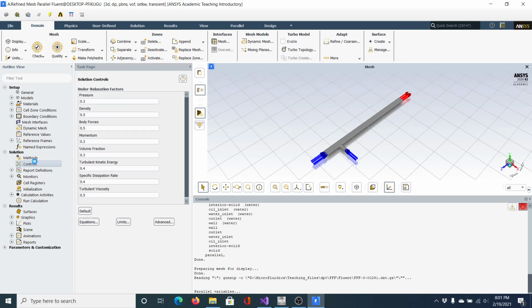So if you go into controls, you'll notice that these values are changed. What's happening is the system is trying to solve the process, but it's going too fast. So the solutions are being solved too fast for it to be accurate in the mesh. So then when that equation goes on to the next mesh, it's not accurate. So the solution is diverging, and we want the solution to converge. So lowering these factors can help that. The caveat with that is it's going to take a lot longer to get a solution.